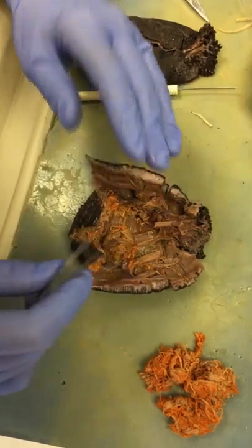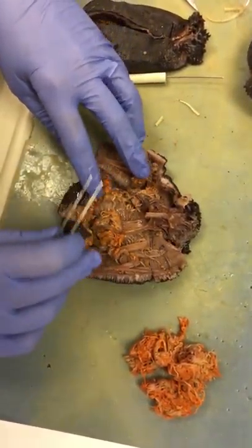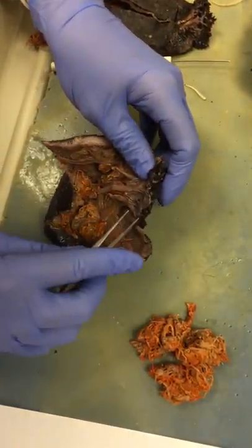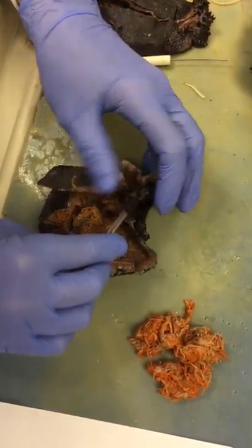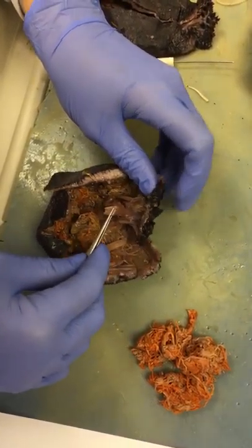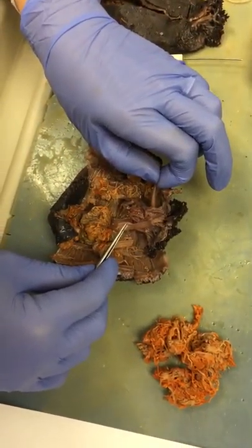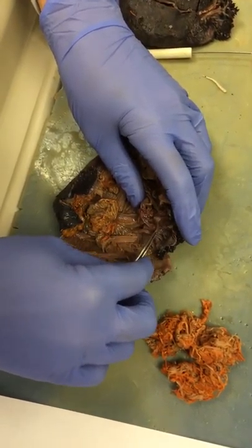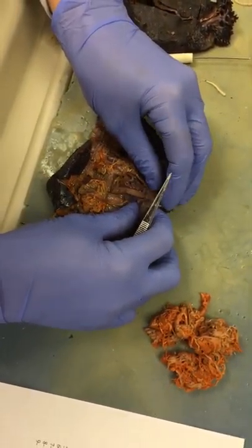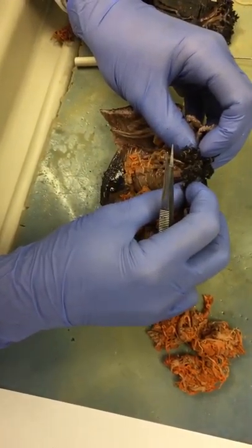The gonopore is the point at which the gametes will exit during spawning. The next thing we're going to look at is what the tentacles are attached to and how they move in and out. This structure right here — we can see a few of them that are cut — these are retractor muscles, and they will actually get longer and shorter, pulling the tentacles in so they're hidden, or out when they're feeding.